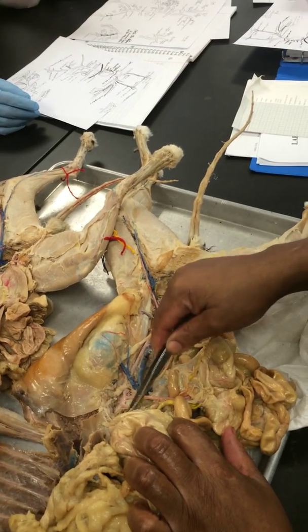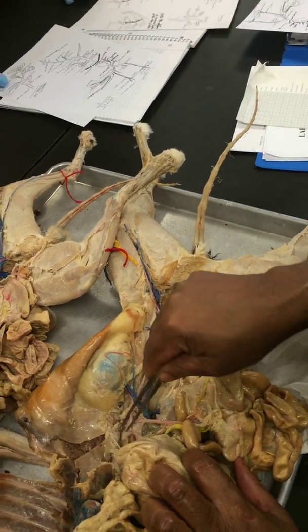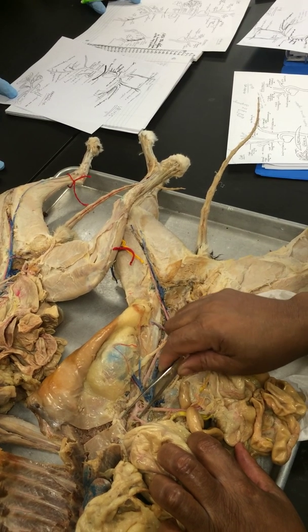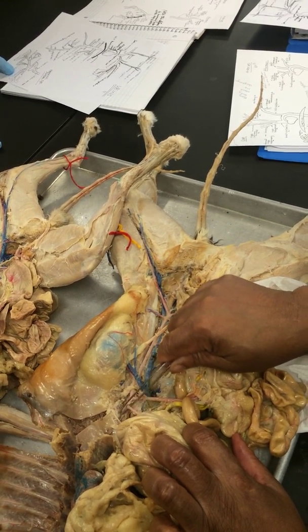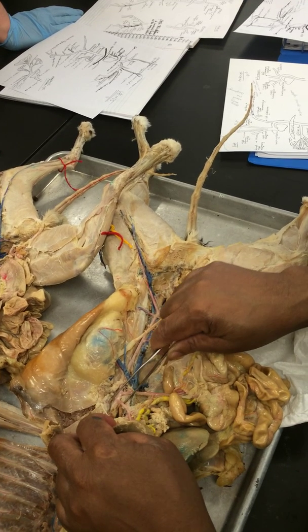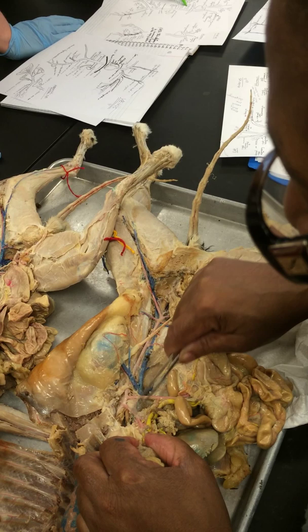So for the red ones, starting at your diaphragm, that's your diaphragm. So coming through the diaphragm, you're going to have your abdominal aorta. That's that long piece coming down. And the first time it branches, it's a singleton. It doesn't have a pair. It's asymmetric, we call it. And it comes off, and that's your celiac artery. And it's going to be celiac until it branches.